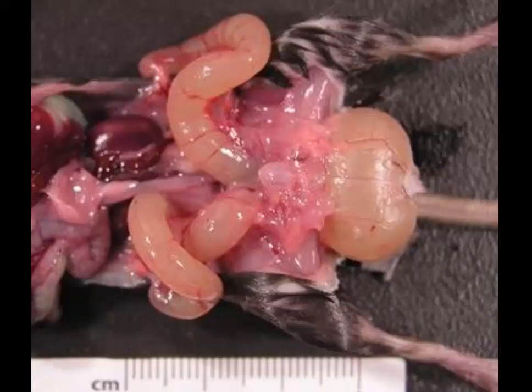Slide number 8, we're going to stick with the lab animals. This is tissue from a mouse. I would like for you to give me 2 morphologic diagnoses. Okay, time's up. We have 2 very large organs here. We have this one and we have these. Now, if you thought that, here's a little urinary bladder here, if you thought that this was a male mouse, I'm sorry, you're not going to get this question correct.